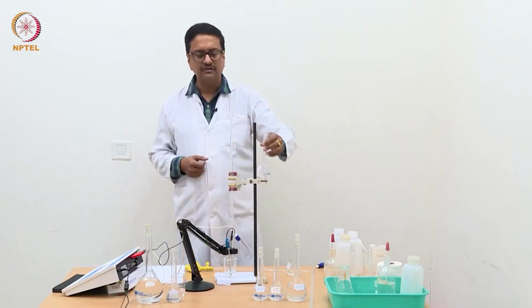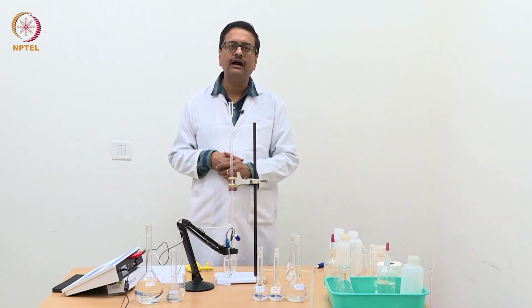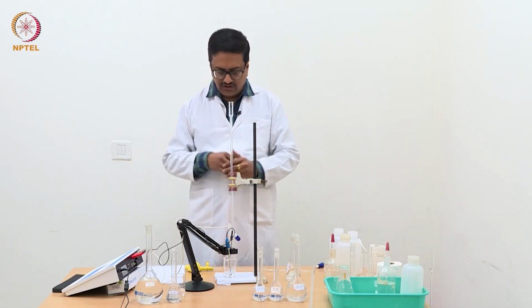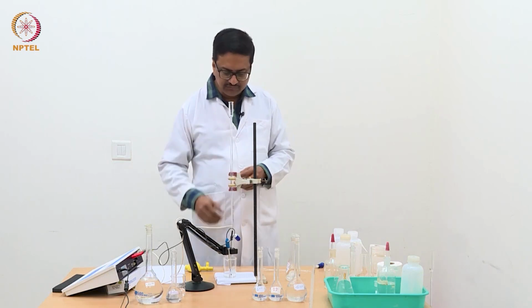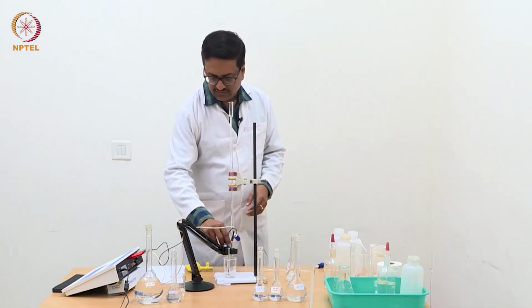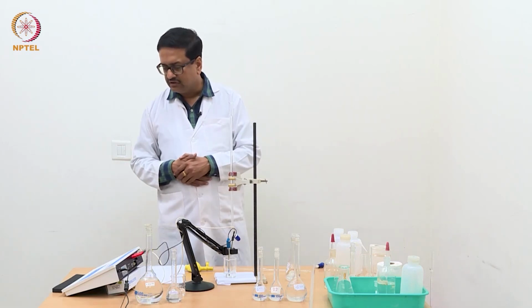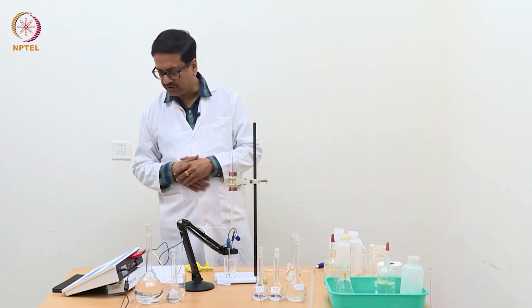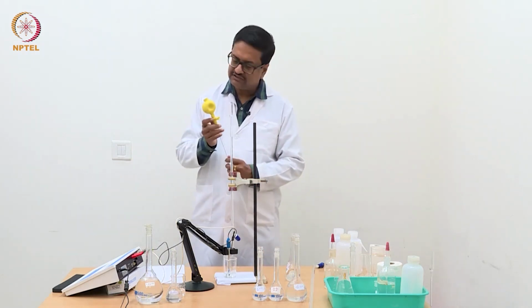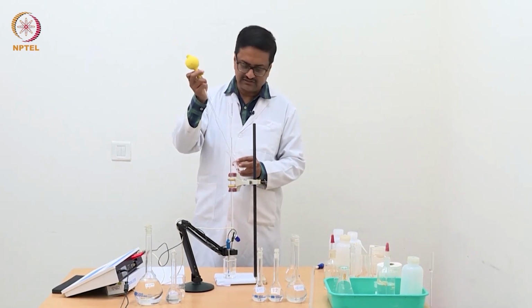As you all know, when we add silver nitrate to a solution of chloride, a curdy white precipitate forms. You will see the same phenomenon happening here. At the moment, what we have taken in the beaker is just some distilled water, and you can see the conductance of that distilled water is shown here. It is about 8.72 microsiemens. Now I am going to pipette out this triple mixture and add it to this water for the estimation.